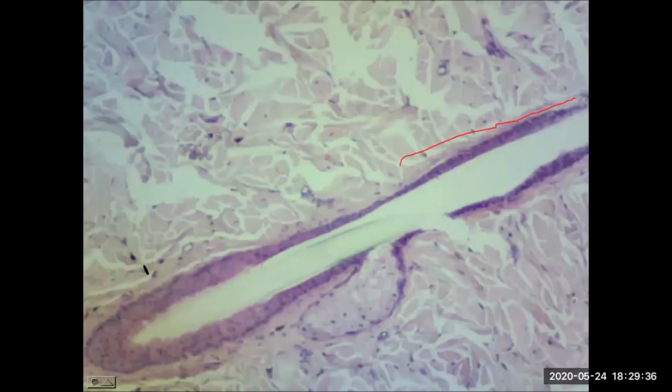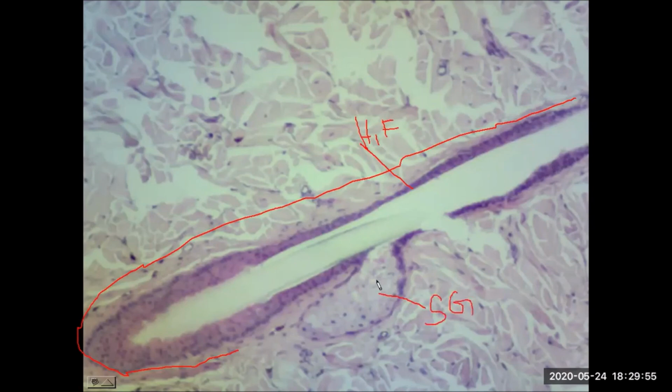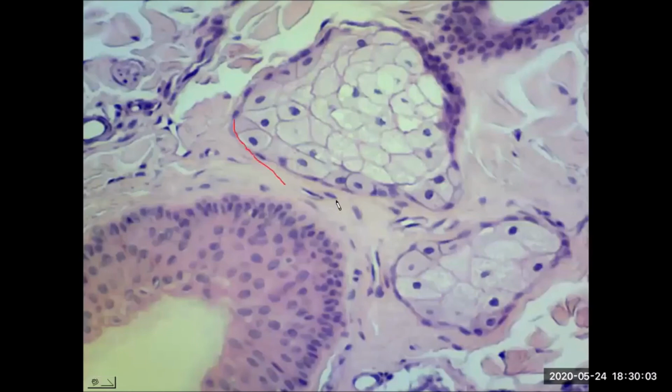We see much more length of the hair follicle. So this cuts right in the plane to follow the length of the hair follicle. And we once again can see some of that hair that's still running within that hair root. And another good example of a sebaceous gland. And you can really see it leads right into that hair follicle. And this is now just a much closer magnification of segments of a sebaceous gland. And once again, that associated hair follicle.